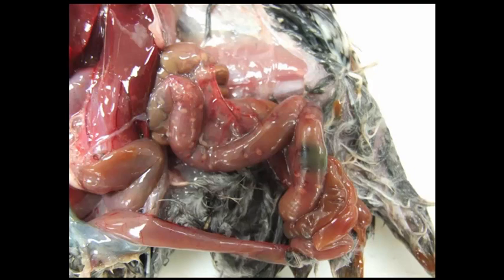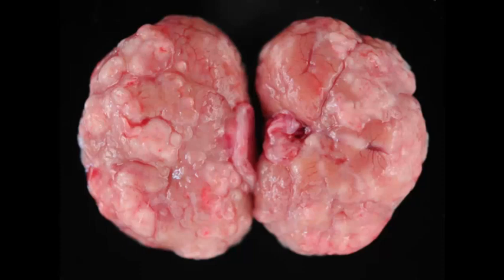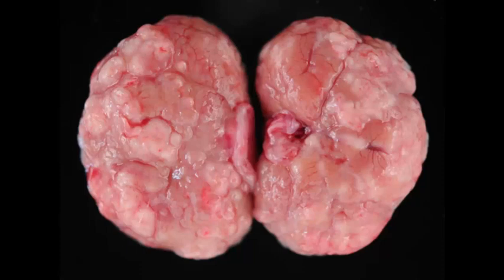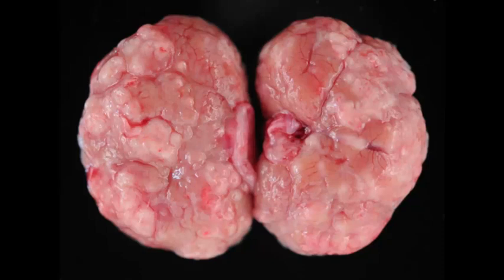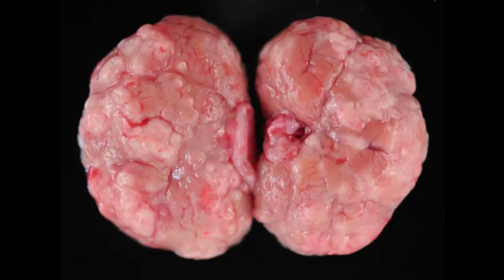Let's move on. Slide number two is tissue from a cat. I would like for you to give me a morphologic diagnosis and a cause. This is a very classic lesion in a cat. Whenever you're looking at the kidneys of the cat and you see white nodules on the surface of the kidney, you want to think of two things: renal lymphoma or feline infectious peritonitis. And then the big question is, is it tracking vessels or not?